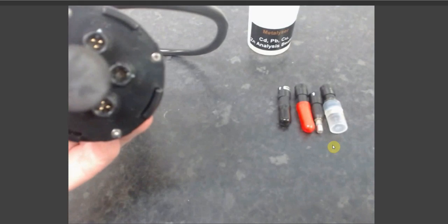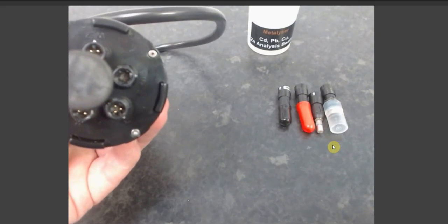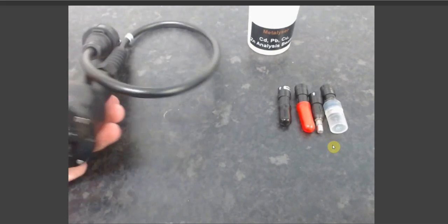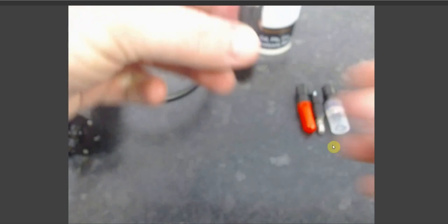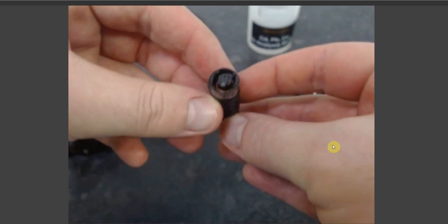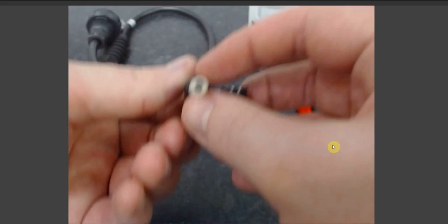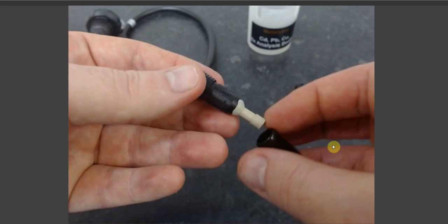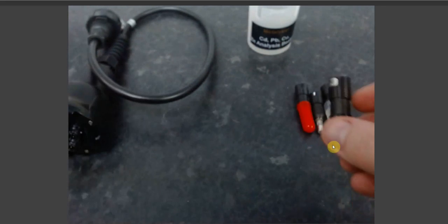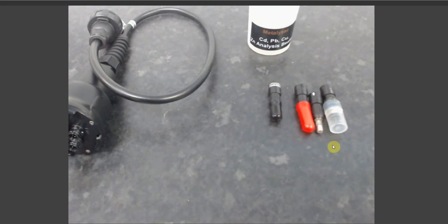The reasoning behind having 3 working electrode slots is that there are 3 different types of working electrode. With your HM3000, the ones that you will be supplied with is a WE1 glassy carbon electrode, which will have 6 pins. This is a standard glassy carbon electrode. The WE1 is used for any test that requires a mercury plate solution.